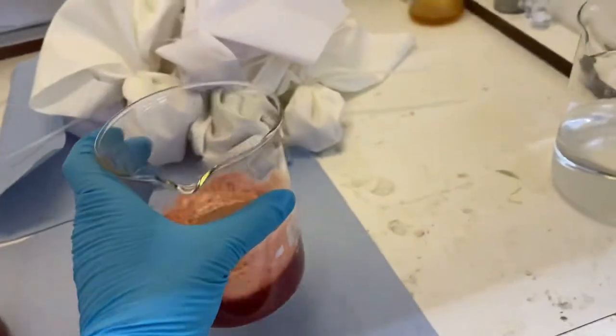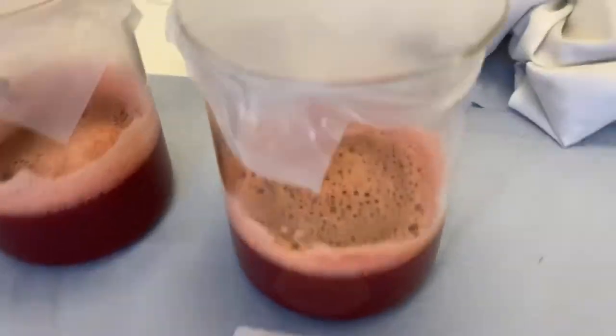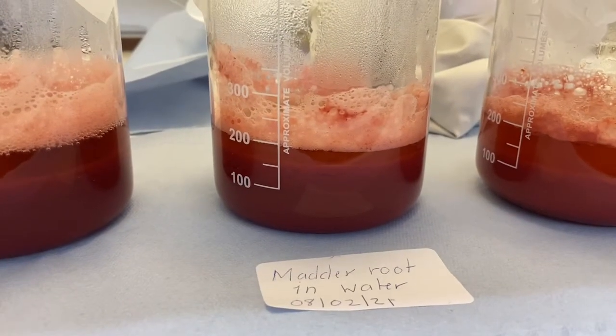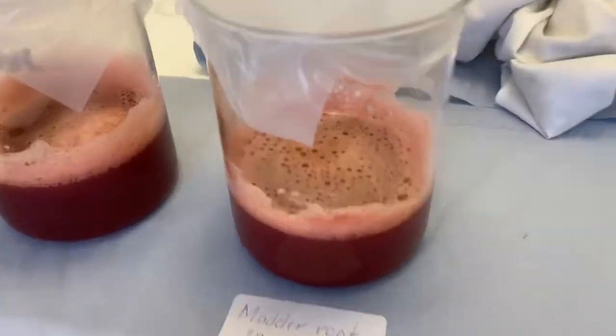Once your pH is at the proper amount and your stirring is complete you leave the dye stuff solution to settle overnight and when you return you probably notice a separation that had happened in the beaker.